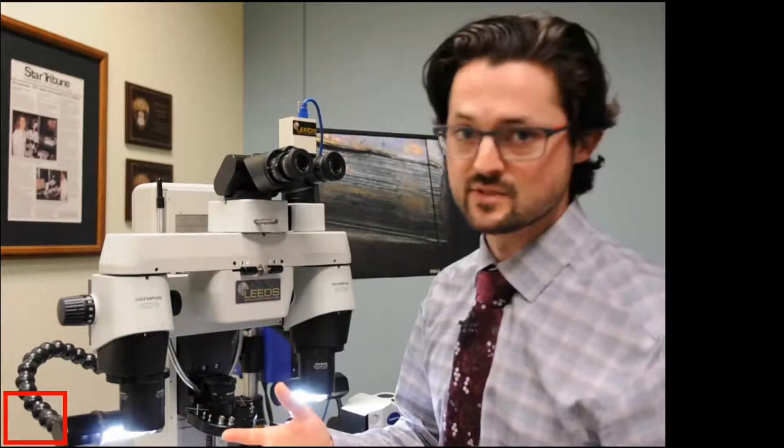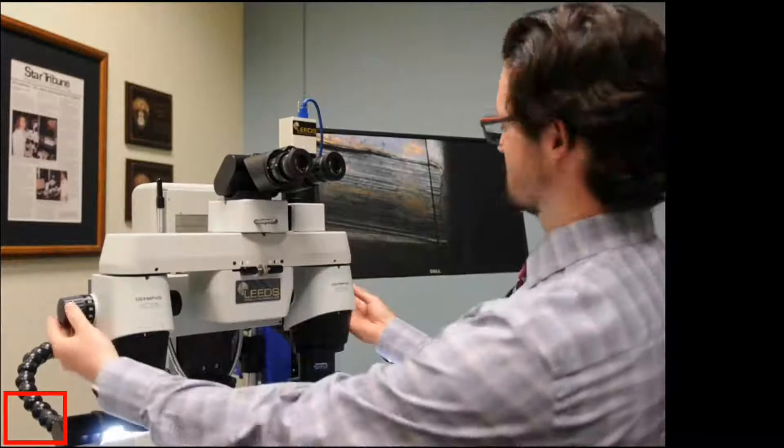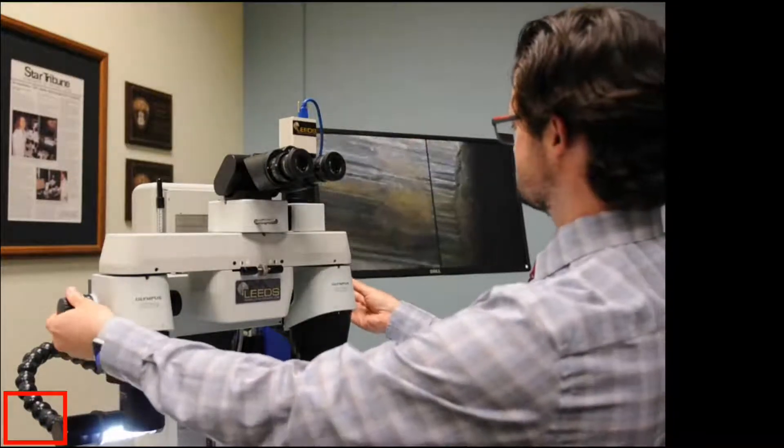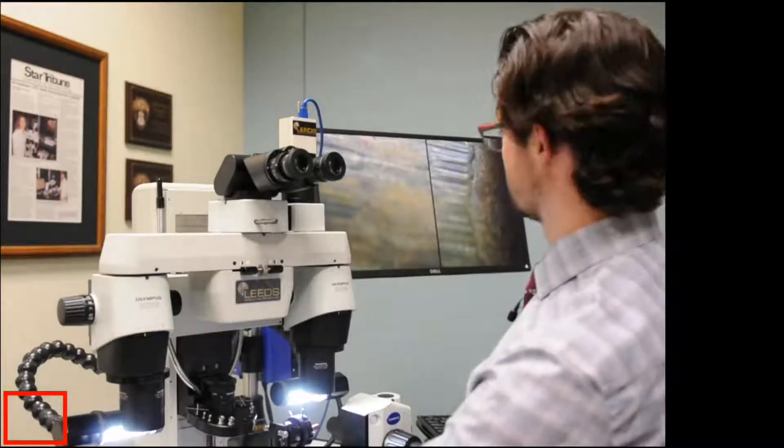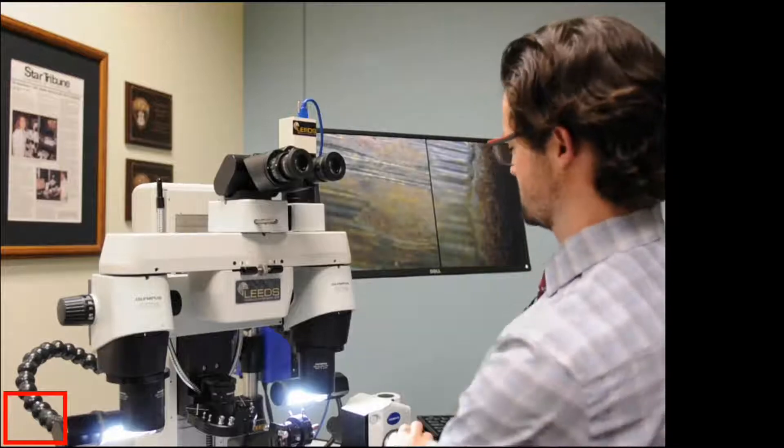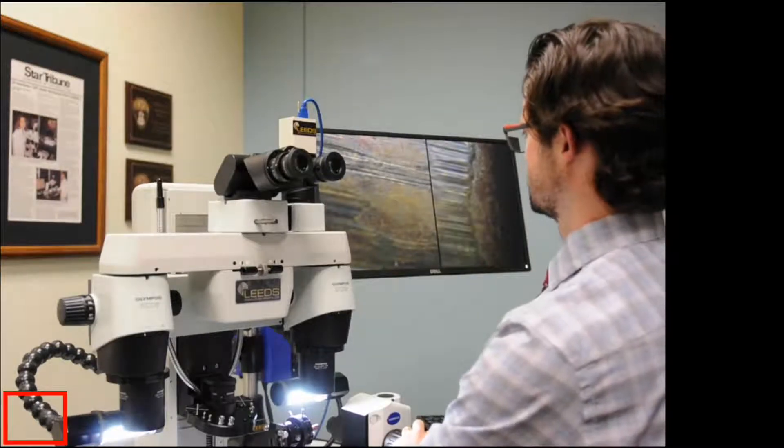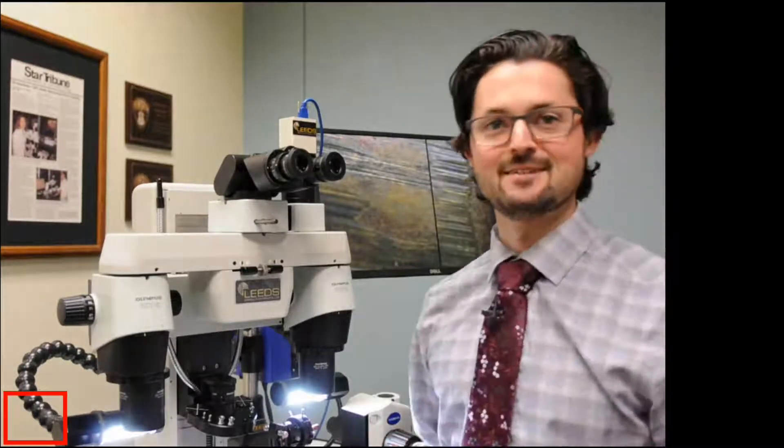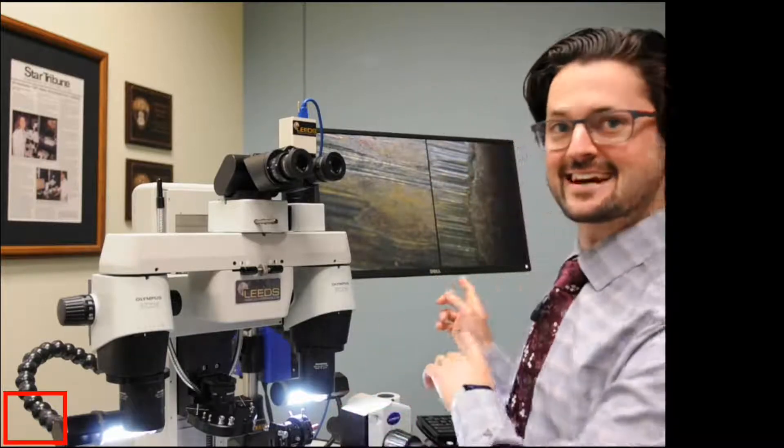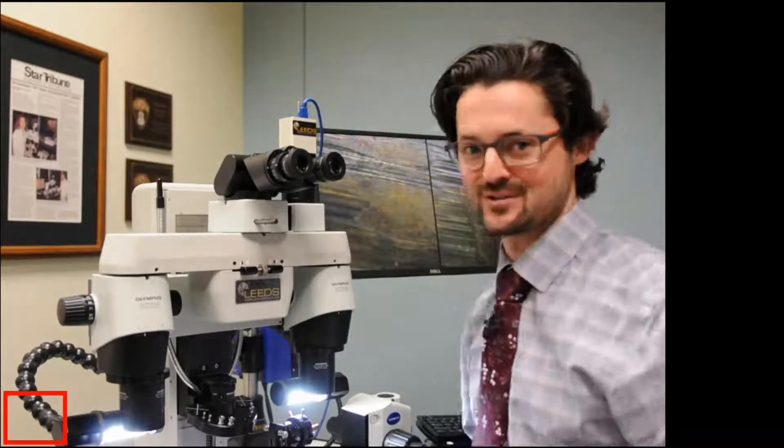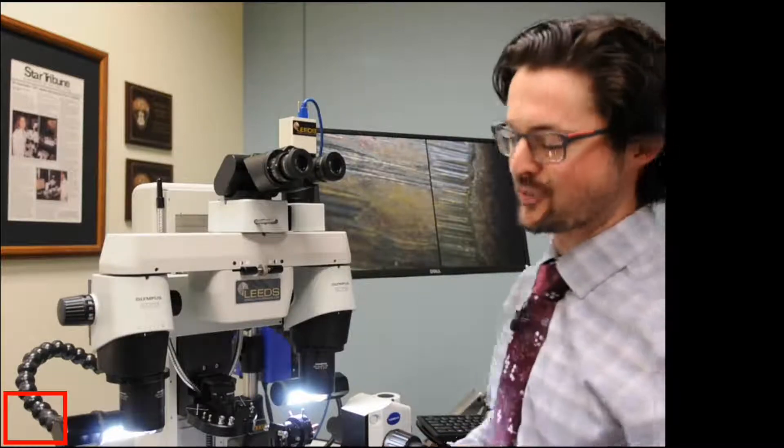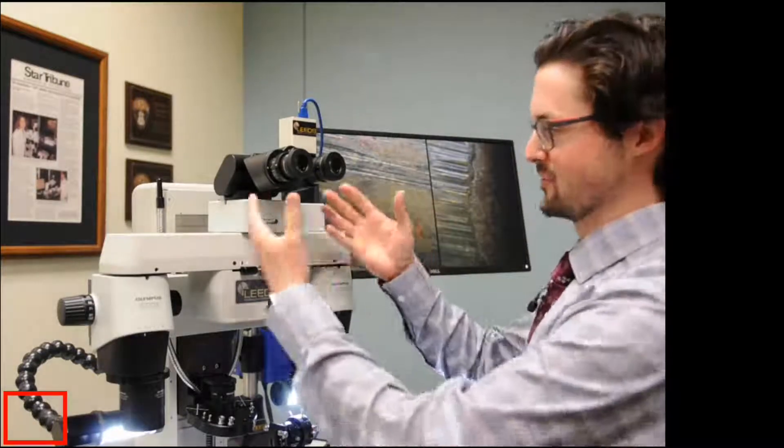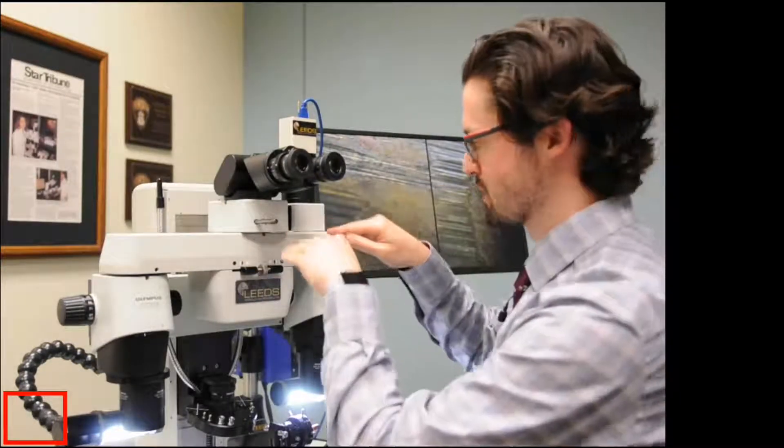So the idea, the whole idea of this is kind of what I'm going to show here is that you can zoom in, you can focus on something. Let's just go ahead and focus on some of the stria here. Also, I'm not a firearm examiner. I think I aligned these okay, but don't judge me too harshly if I didn't.